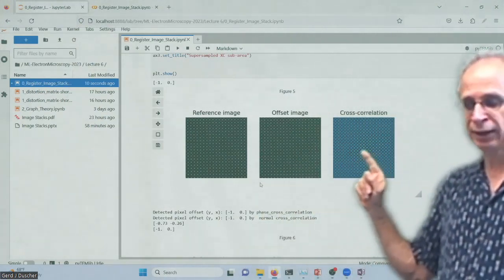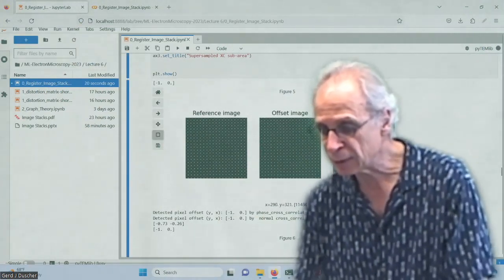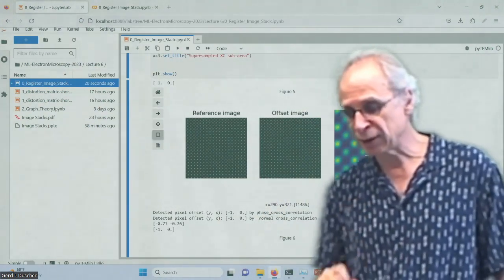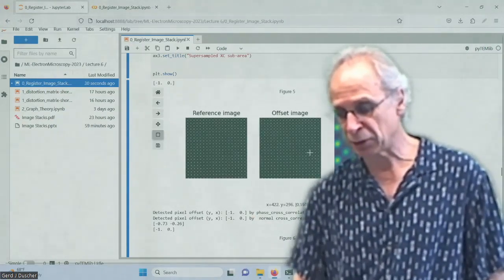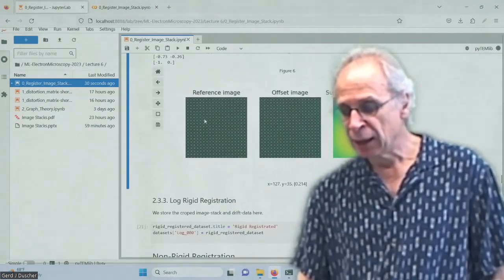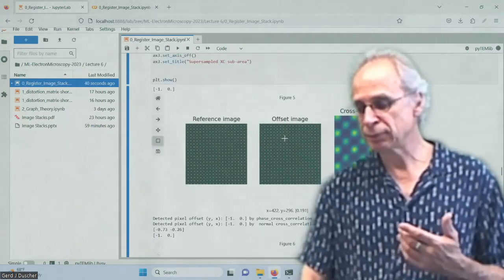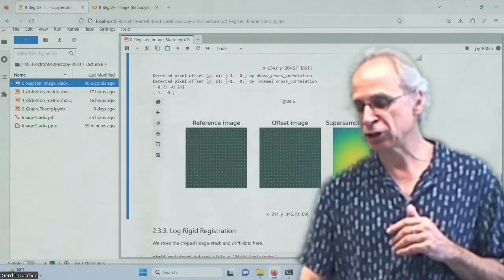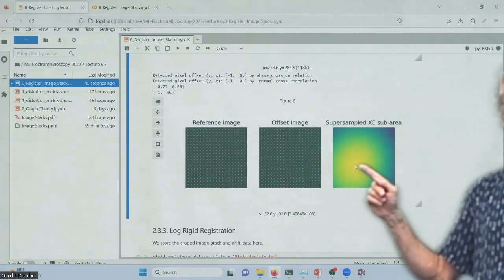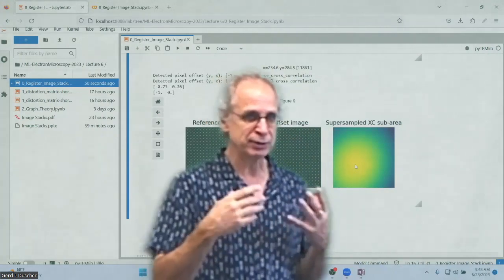And then I get cross correlation here, and so with pixel accuracy, you can determine where your thing is. And here in our case, it's very little, right? 1 pixel. If you upsample this kind of cross correlation, then you can determine the maximum with subpixel accuracy, and then you can do your drift correction with subpixel accuracy.